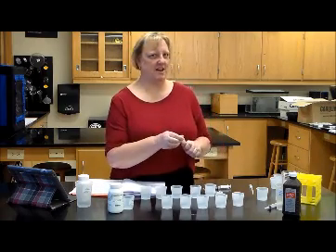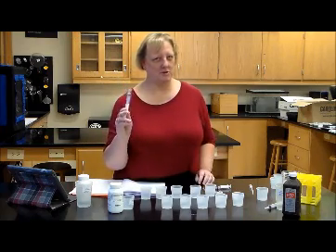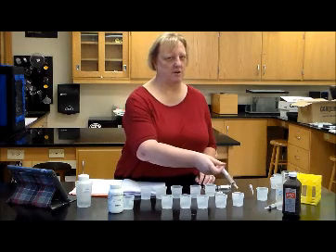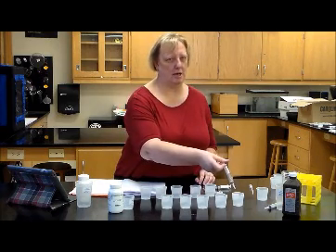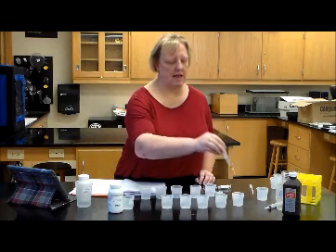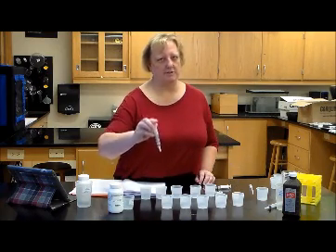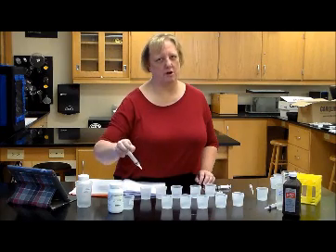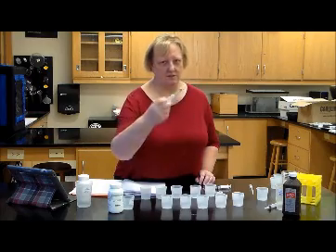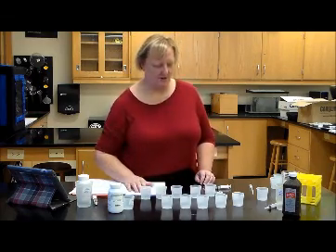Now 10 seconds is not a whole lot of time, so please make sure that you have your H2SO4, sulfuric acid, ready to squirt into that 10-second cup as soon as the 10 seconds is over. Counting your time is very important in this lab, so make sure you have your timer out before you start activity D. Otherwise, you'll just have to start over, and I know you all hate to have to start over.